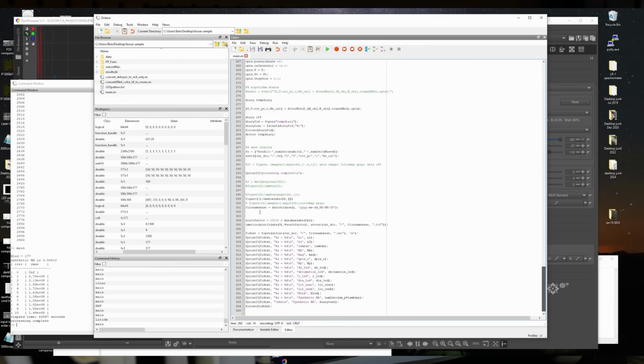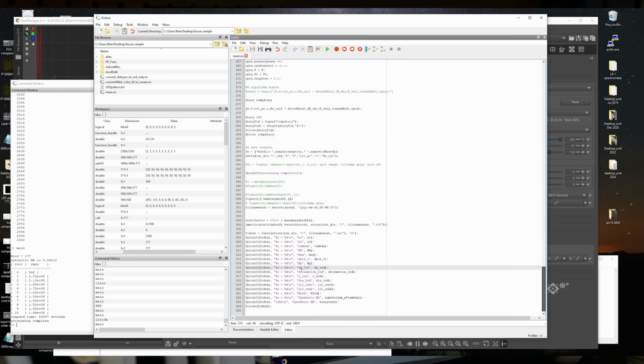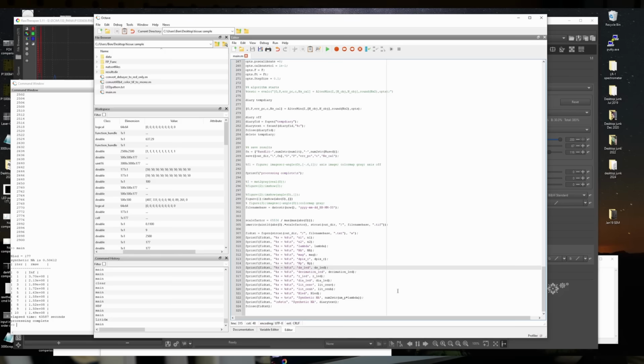The final thing that I added was this function to save all of the parameters used in the reconstruction along with a unique file name. So I ended up iterating through many, many different tweaks before realizing that the Bayer sensor was probably my problem all along. I assumed that the reason this wasn't working for me initially is because I just didn't have all these parameters set up properly. So I made this just automatically come up with a new file name to save all the parameters to figure out what I did.